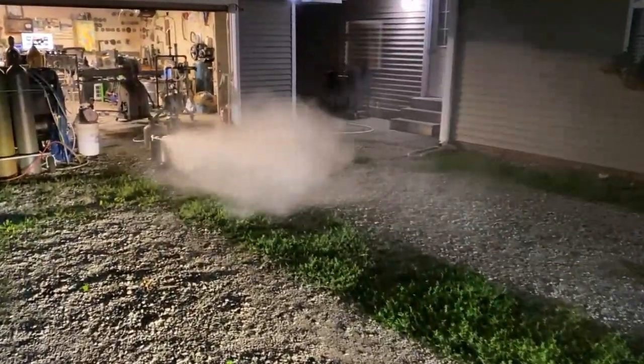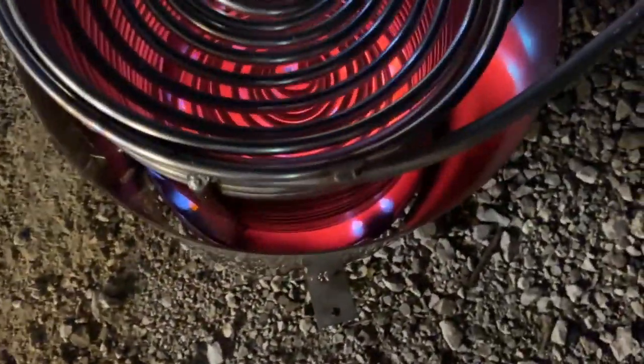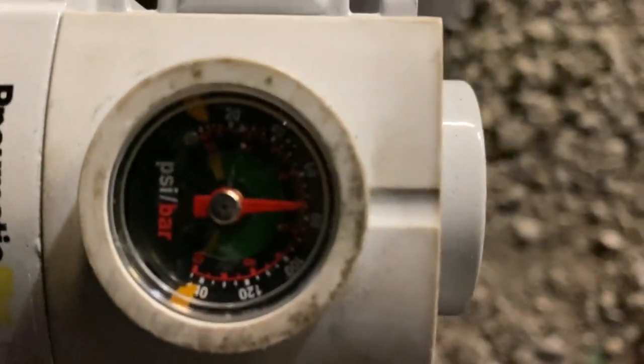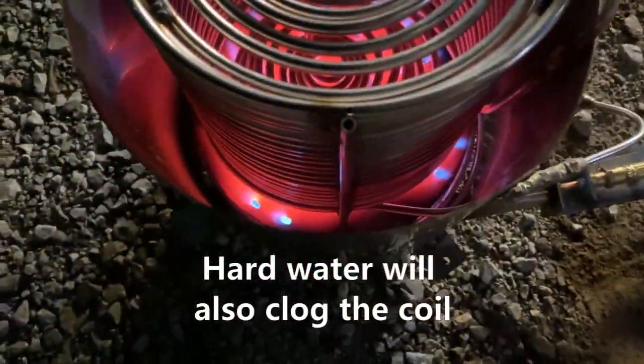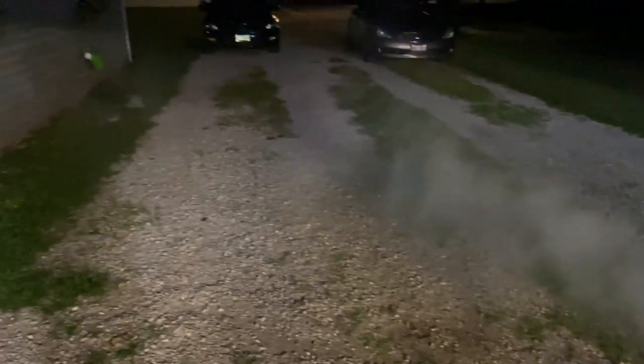As far as maintenance goes, there's a lot going on with stainless steel on a system like this. If you can somehow use distilled water, that is ideal. In your case you're saying you're going to be using a water softener — I also suggest trying to get a reverse osmosis filter. The flow rates of those are very low, but also the flow rate of this device is quite low, so you might be able to find a reverse osmosis filter system with a flow rate compatible with the 1 liter per minute this thing is going to boil. You are going to want to run some descaler through this coil on occasion to clear it out, because it will get buildup inside if you run it on very hot steam. Also on your ductwork system, if the holes are too small on your distribution manifold, the adiabatic expansion will cause steam to condense back into water. Try to avoid very small pinhole-type discharge vents on your manifold.